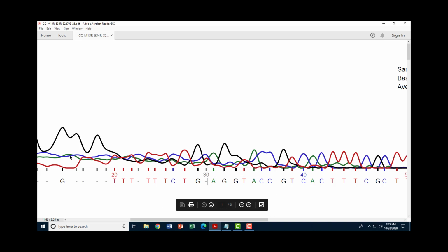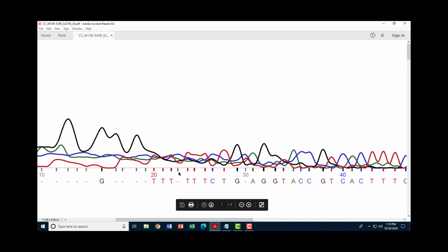And then I start moving backwards towards the beginning of the sequence and see if I can do that for any other position. Here, I've got relatively low signal for thymine, low signal for guanine, low signal for adenine, but I've got a relatively high signal for cytosine. So I would probably plug in a C at that position. I move back here and keep looking. Now here it's hard to tell.